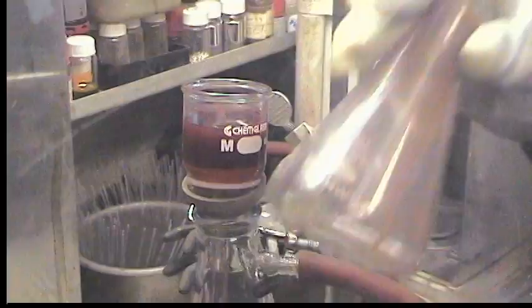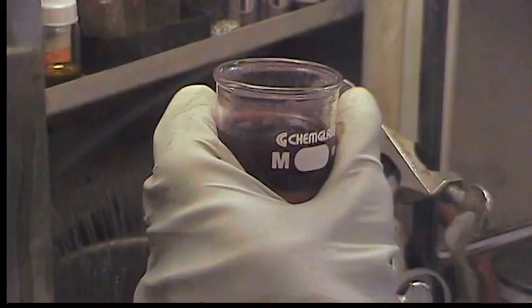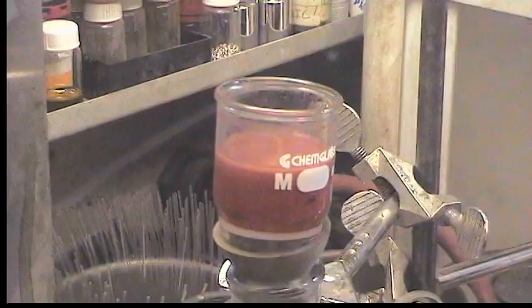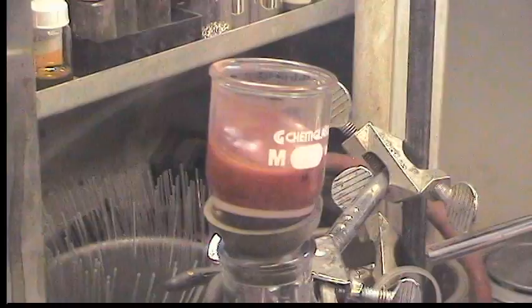This tin can be saved and recycled for a subsequent step or a repeated synthesis. Typically we would put the flask into a vial and label it recycled tin. What I'm going to do is break this vacuum and stir this up.